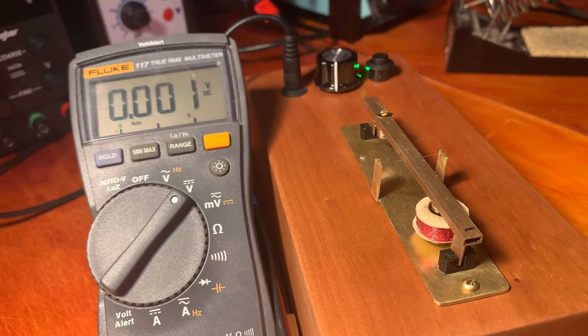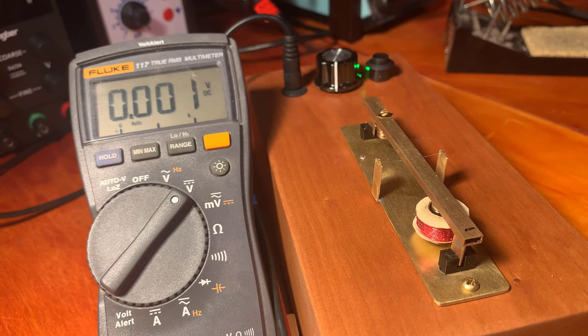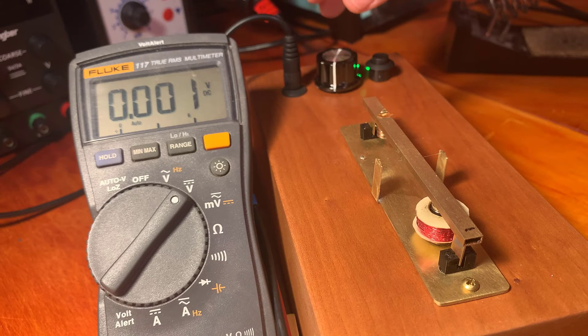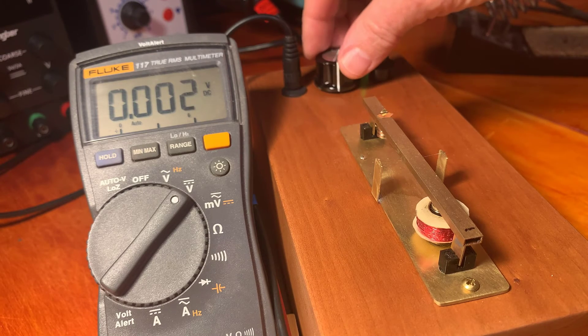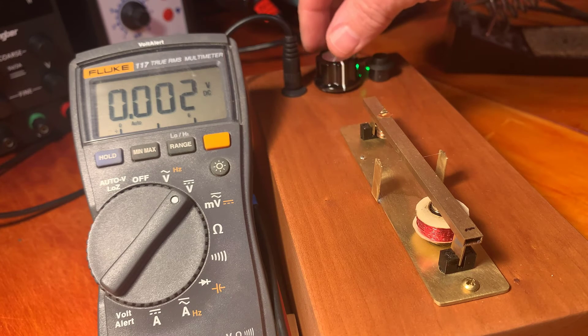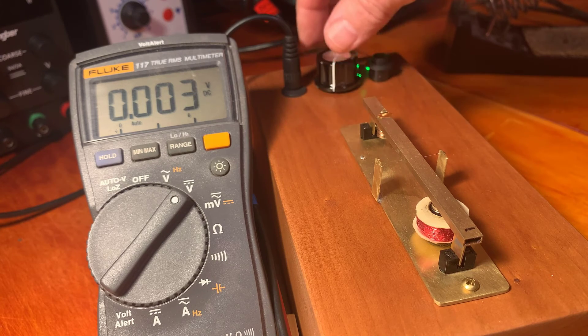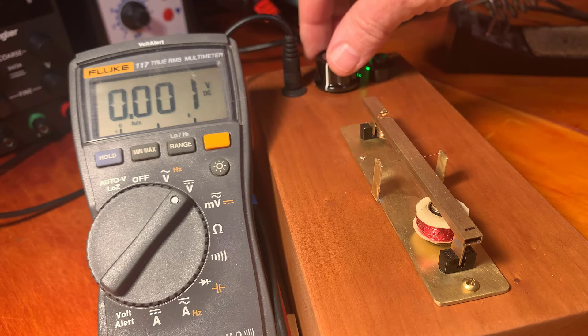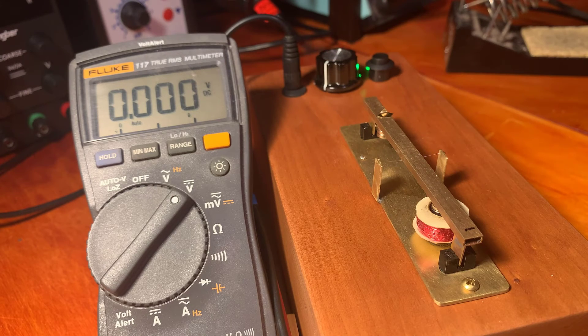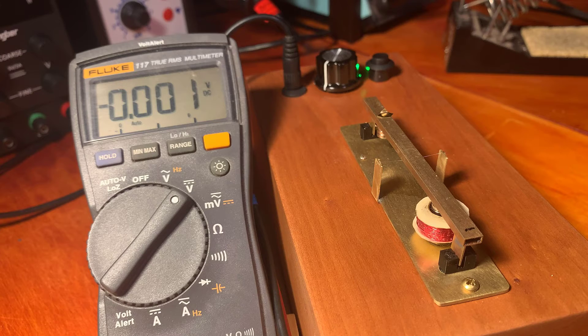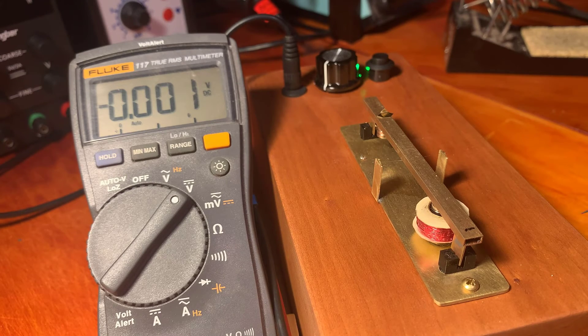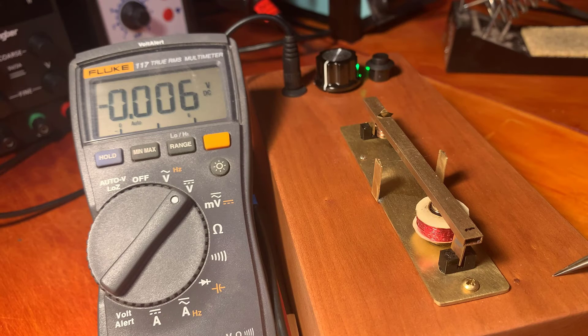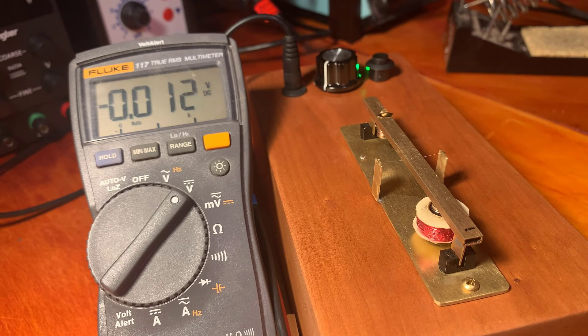The balance is zeroed. Although we're good enough. I don't know which way I go with this knob. I just lost it.